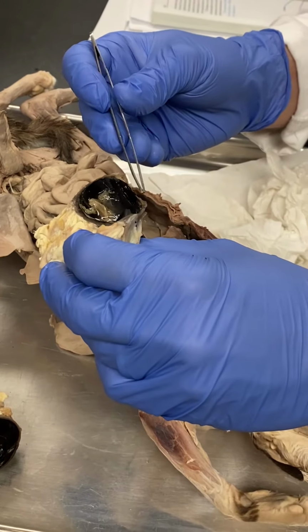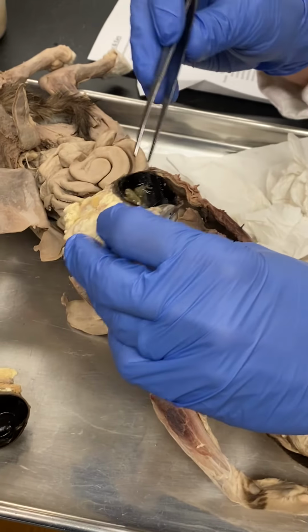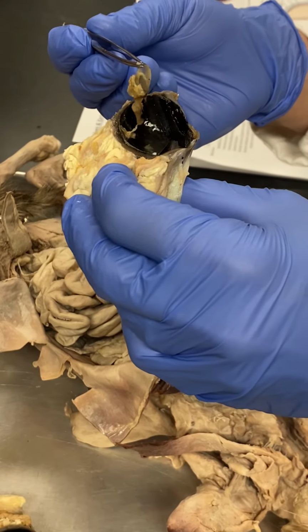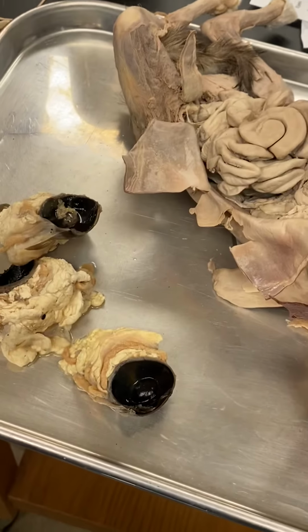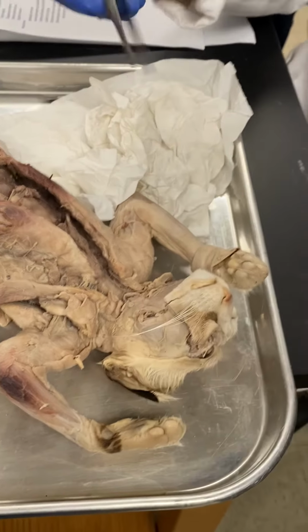You do need to know that in front, where the iris and the cornea would be, it's the aqueous humor. The vitreous humor is a little bit more viscous, and that's the clear stuff that you can see all up in the retina. Okay, it looks kind of like boogers. All right. So there's the eyeball. Now let's look at the cat. So I was able to get a left eyeball out, like that.